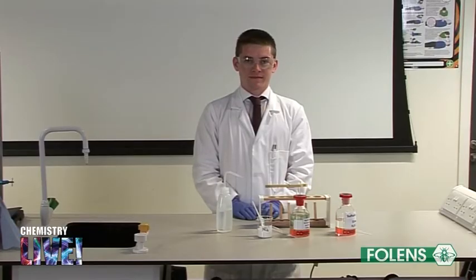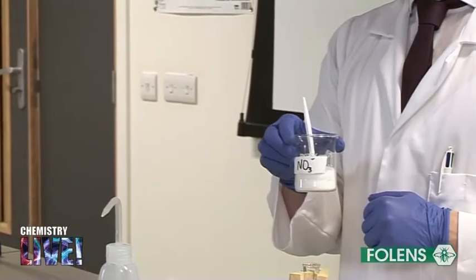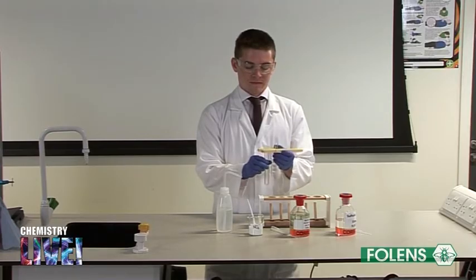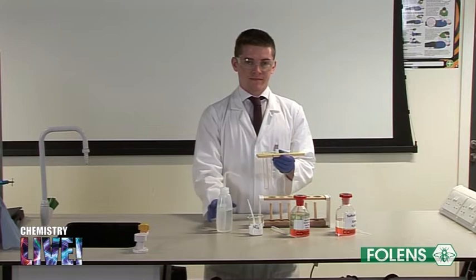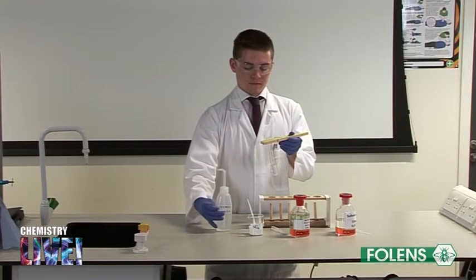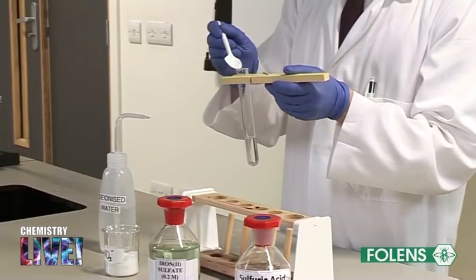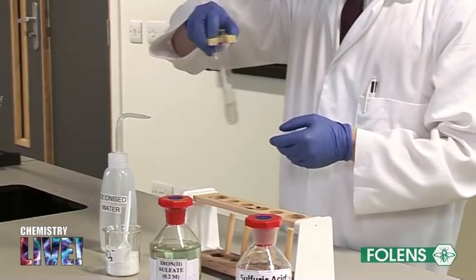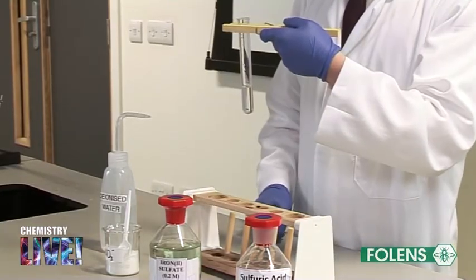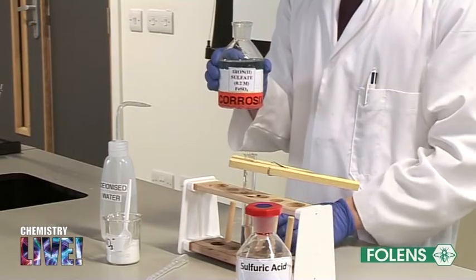Experiment to detect the presence of nitrate ions NO3- in aqueous solution. Since all nitrate salts are soluble in water, it is not possible to detect the presence of the nitrate ion by a precipitation reaction. A special test called the brown ring test is used to detect the presence of the nitrate ion. Using a wash bottle of deionized water, fill a test tube to about one quarter of its capacity with deionized water. Add a small amount of nitrate salt — a few crystals are sufficient — to the water. Shake the test tube to help the salt dissolve. A clear solution should be obtained. Add the same quantity of freshly prepared iron(II) sulfate solution to the test tube.